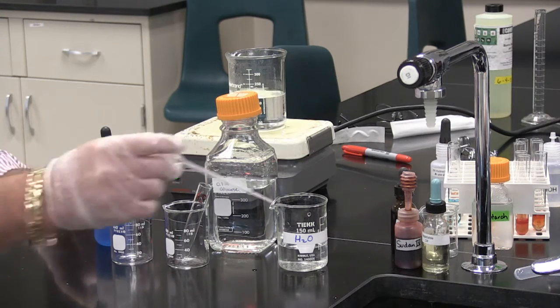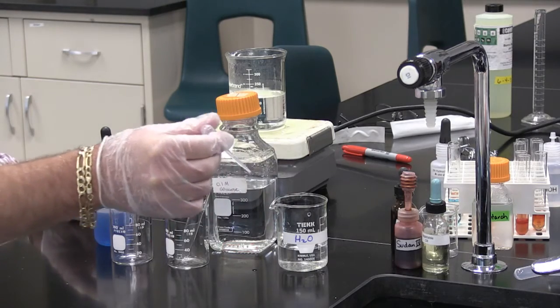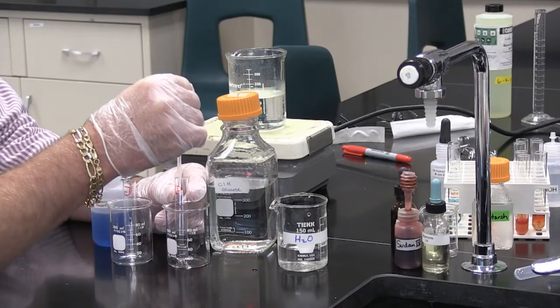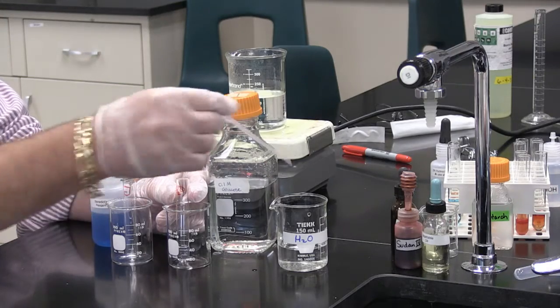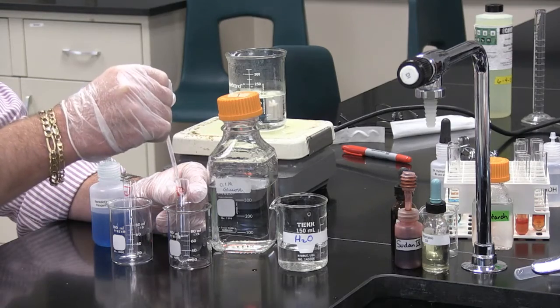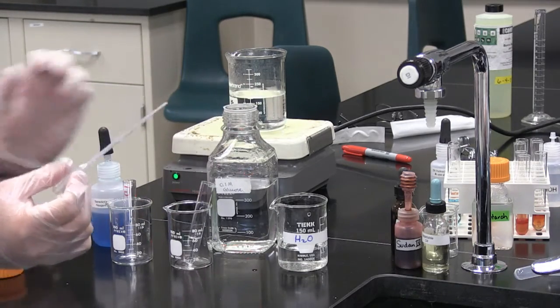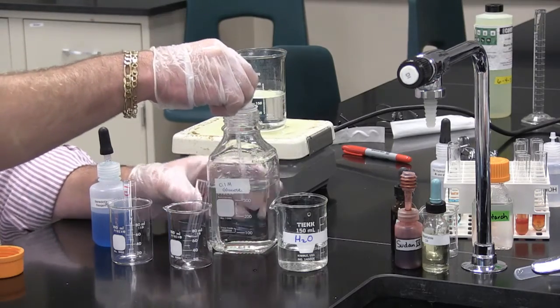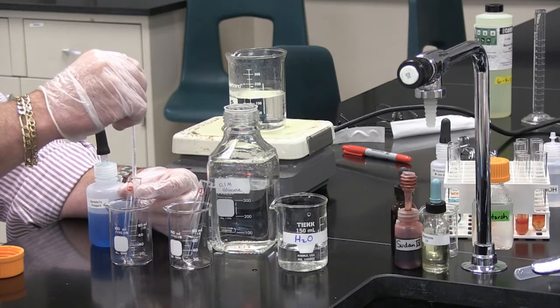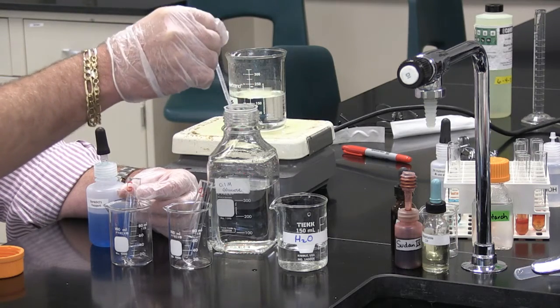So to do this, we are going to put two dropper fulls of water into one test tube — I have this labeled H2O. Then we are going to put two dropper fulls of glucose solution into the other test tube — I have this one labeled G.